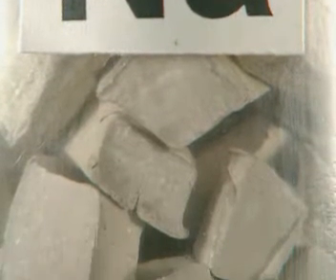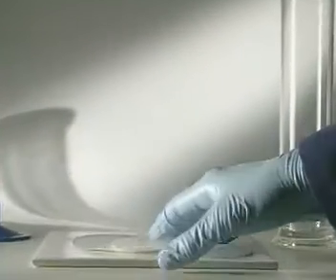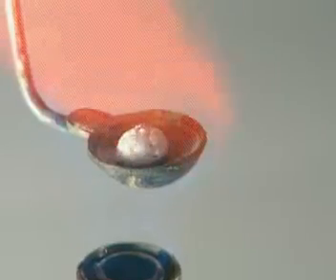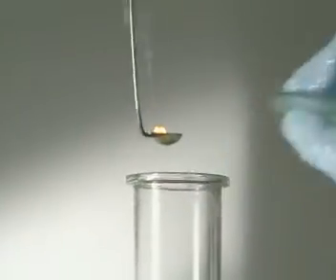Sodium is a very reactive metal. It's stored under oil. Filter paper removes the oil and then it can be heated. Add it to oxygen and it forms white sodium oxide.